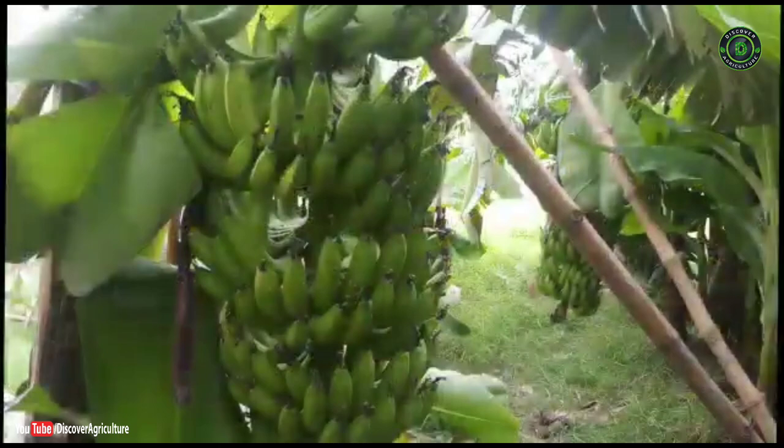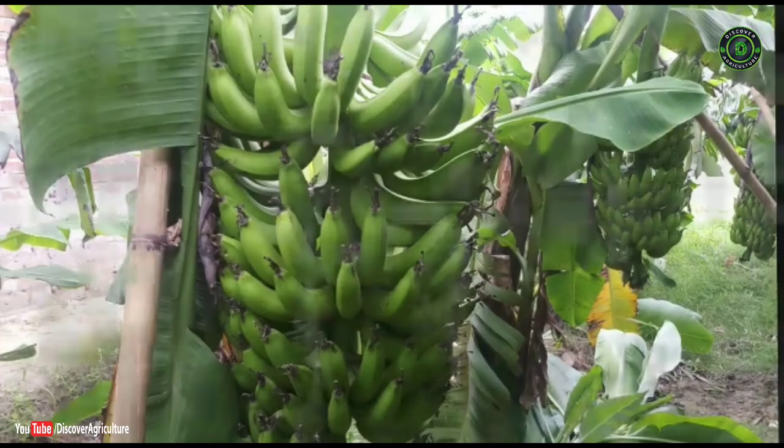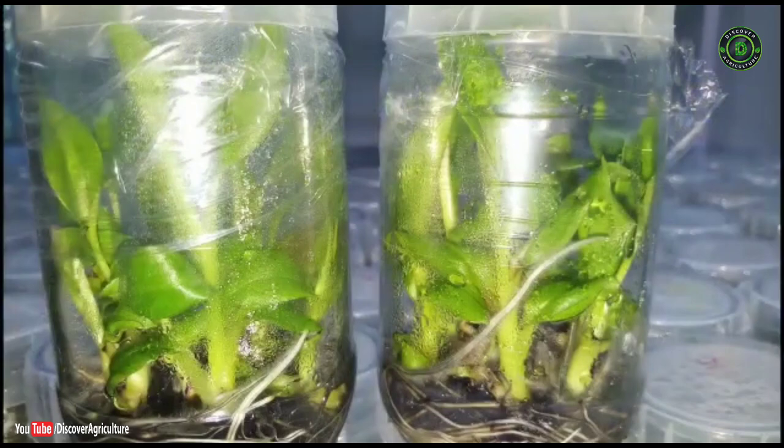Micropropagation facilitates production of a large number of plantlets, thus helping in rapid introduction and dissemination of new varieties.